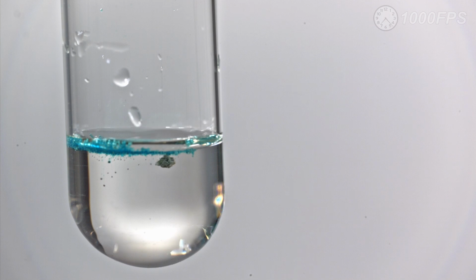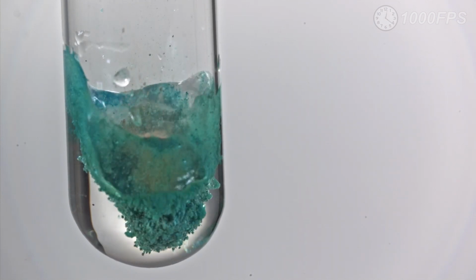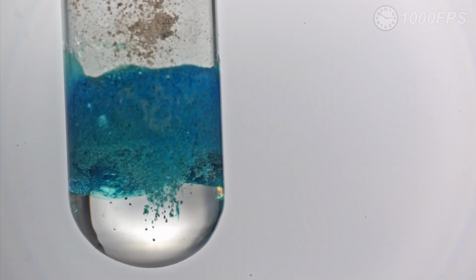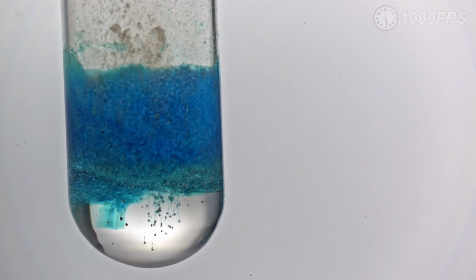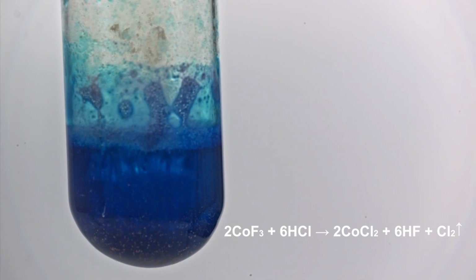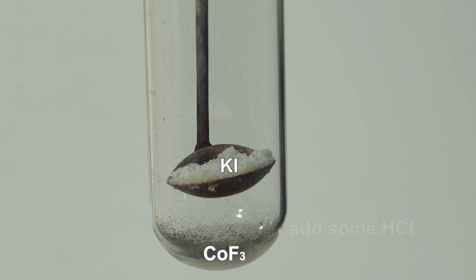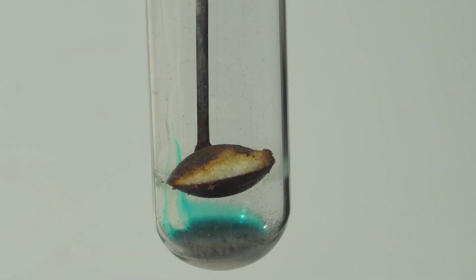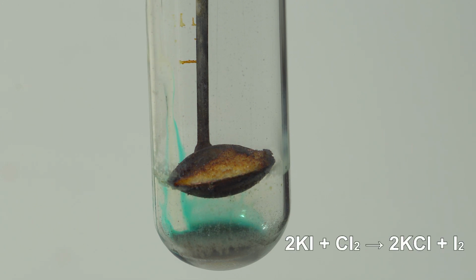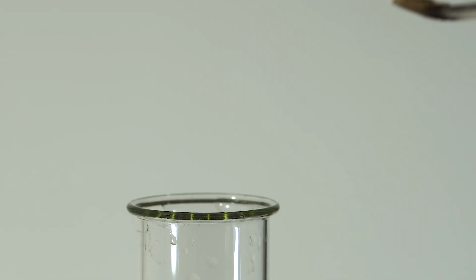Hydrochloric acid reaction with cobalt trifluoride results in the evolution of chlorine and hydrogen fluoride and the formation of cobalt dichloride. Chlorine evolution can be detected by potassium iodide darkening due to the formation of iodine. Reacting with ammonia solution, cobalt trifluoride forms a precipitate of hexaamine cobalt fluoride.